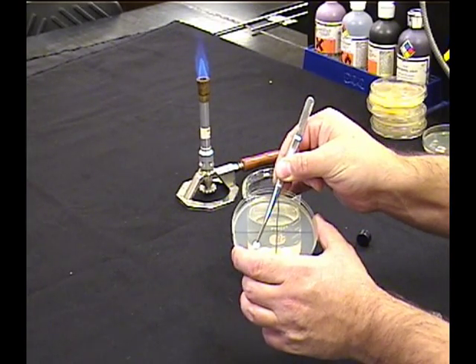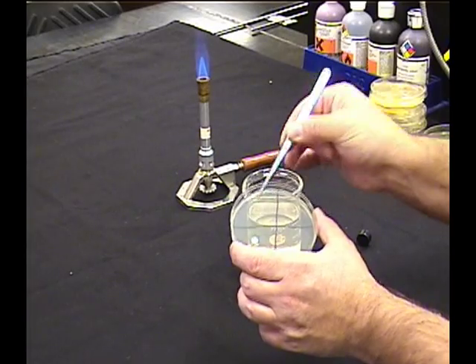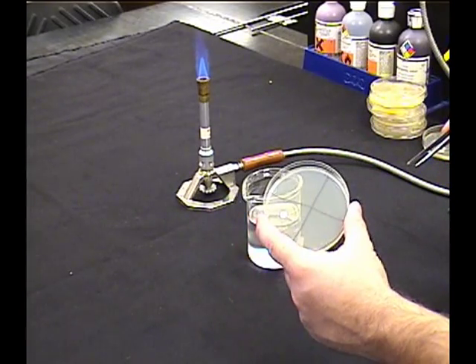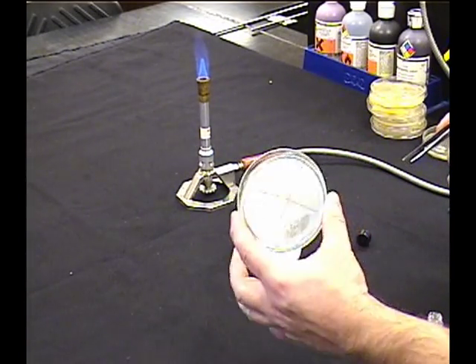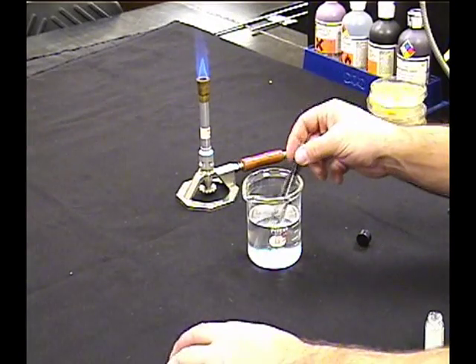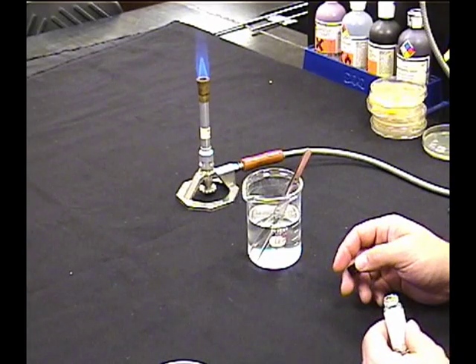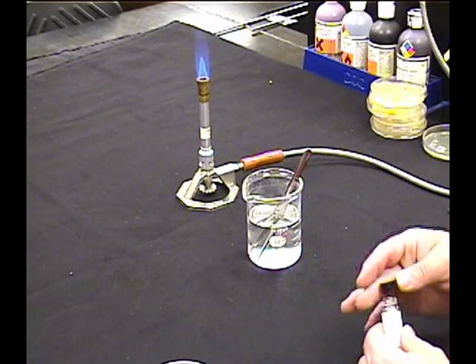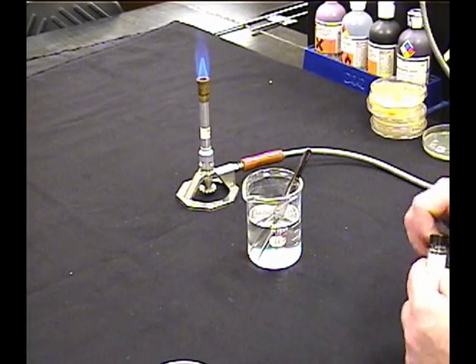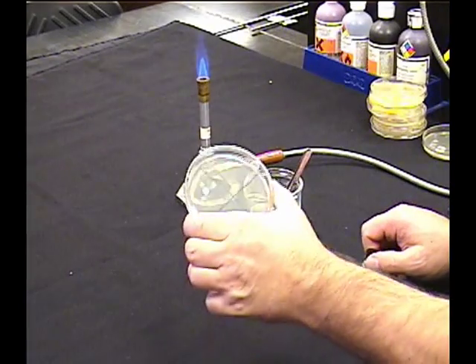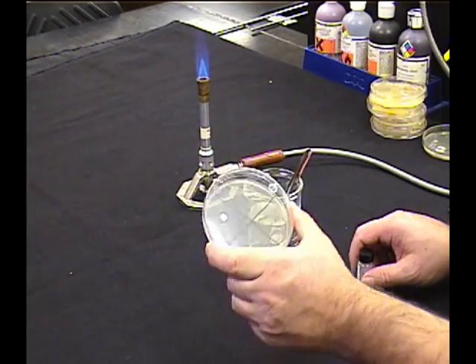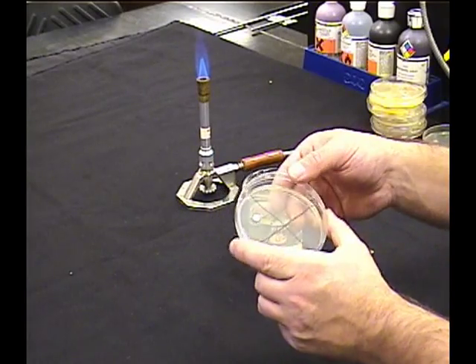In a quadrant right on top of my organism. That's one. Put the forceps back in. Find your next antiseptic or disinfectant. Do it again. You can test four different antiseptics with this one organism on this one plate.